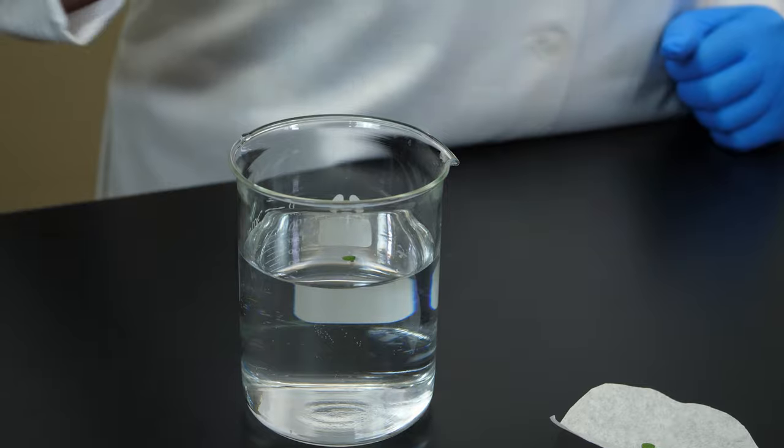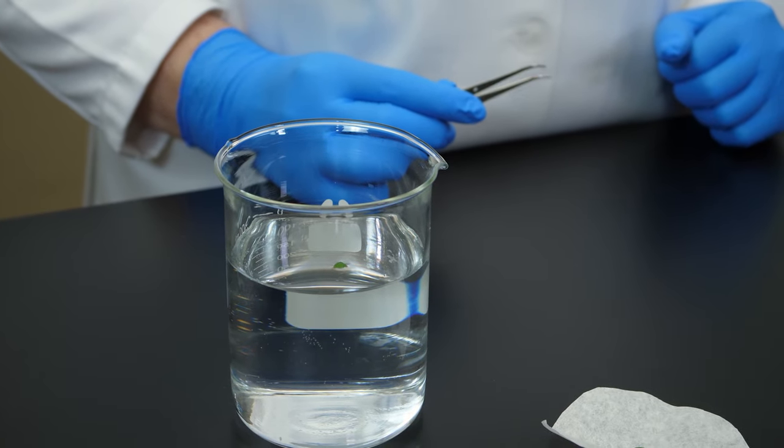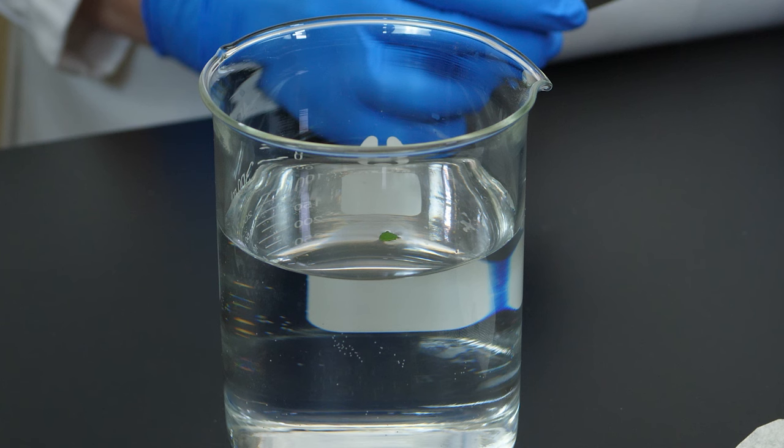If we drop a chad into the solution, it will float. This is because some air is trapped in the layers of the leaves.